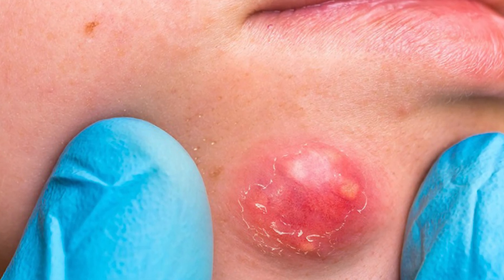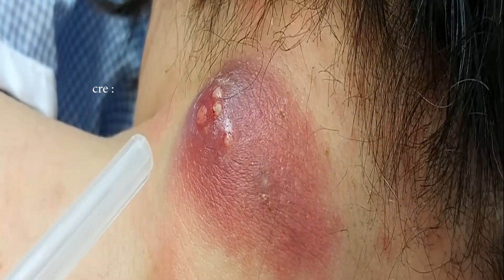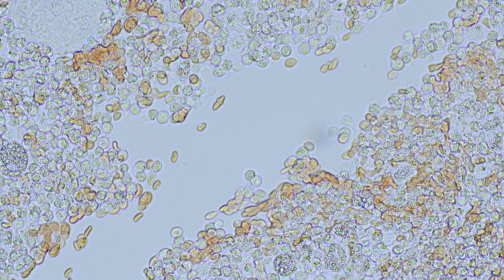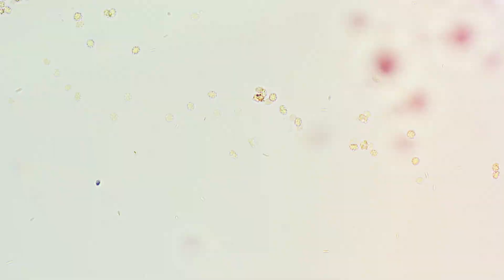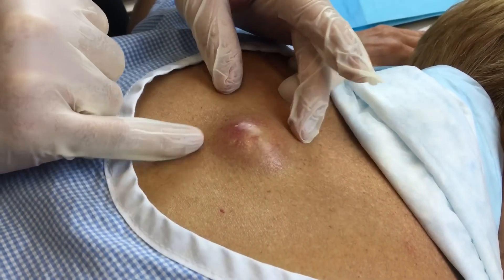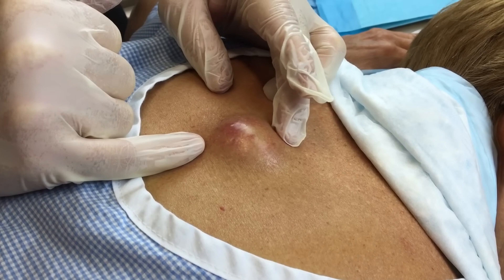Finally, we come to boils — the most dangerous type of acne. This is no longer just a cosmetic issue, but a serious skin infection. Boils typically appear as a painful, swollen lump that grows larger over time and can develop on any part of the body. Under the microscope at 100x magnification, the pus in a boil contains fine hair strands, sebum, yellow pus formed during phagocytosis, and blood. At 400x magnification, we can clearly see a large number of bacteria being hunted and destroyed by white blood cells. In severe cases, boils can lead to abscesses, sepsis, and even become life-threatening if not treated properly. When a boil appears, never attempt to squeeze it — improper intervention can cause bacteria to spread and penetrate deeper into the bloodstream. You need to see a dermatologist for safe treatment.